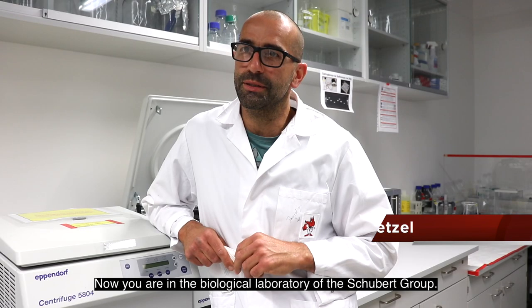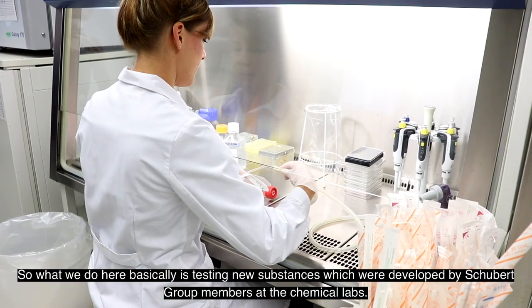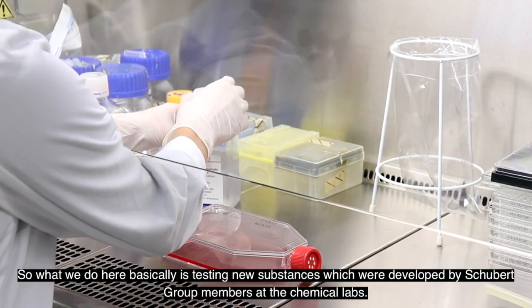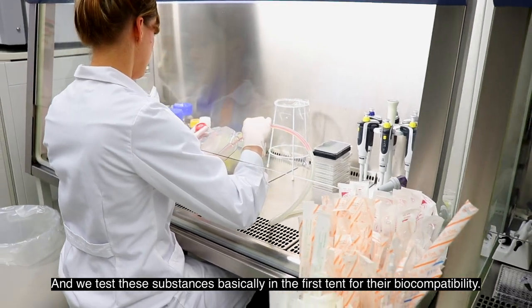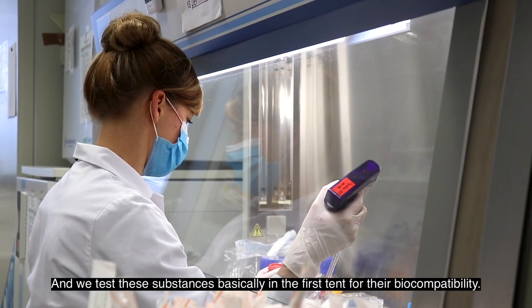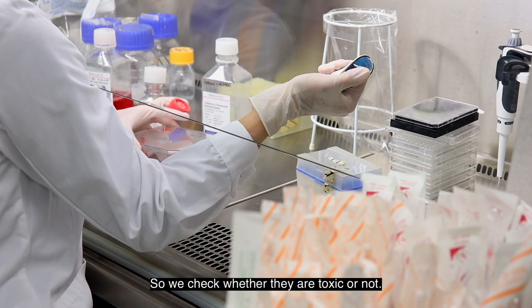You are now in the biological laboratory of the Schubert Group. What we do here basically is testing new substances which were developed by Schubert Group members in the chemical labs. We test these substances in the first instance for their biocompatibility — we check whether they are toxic or not.